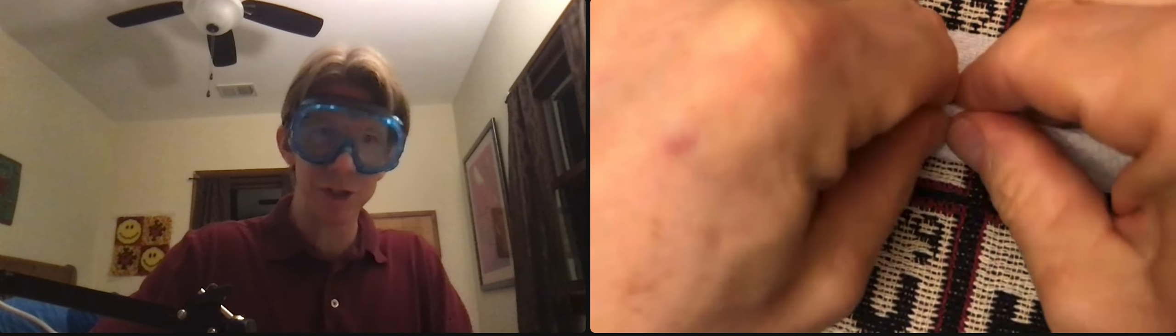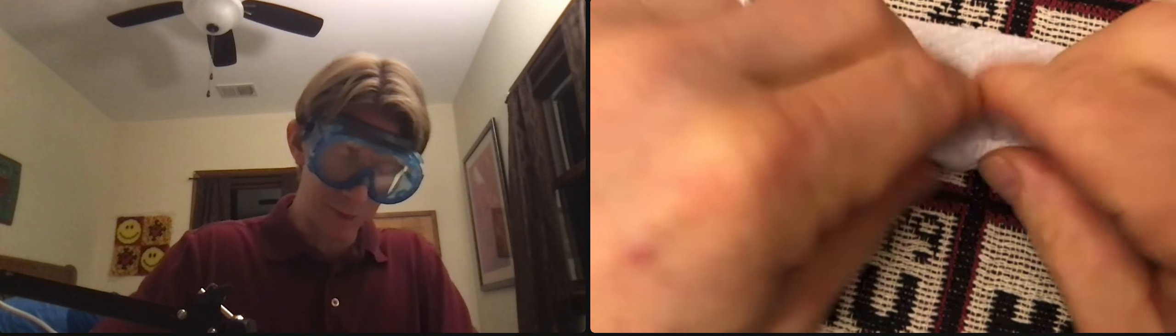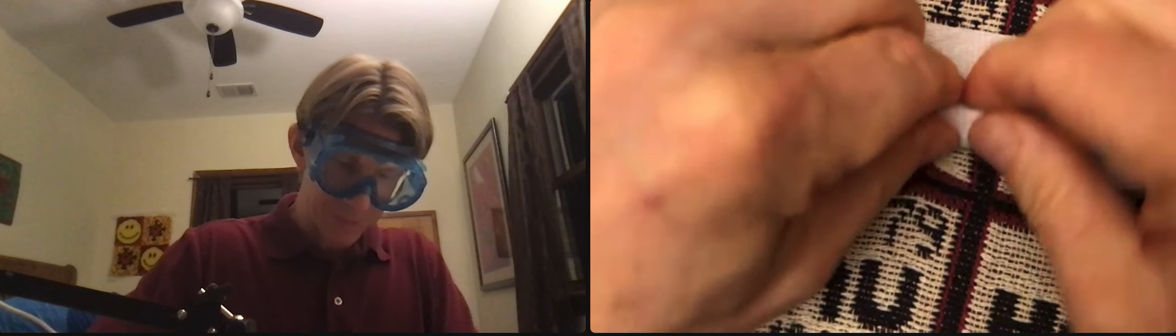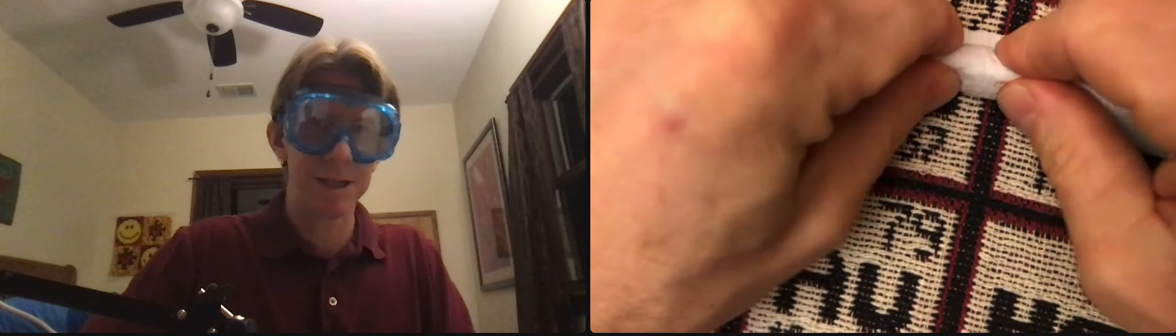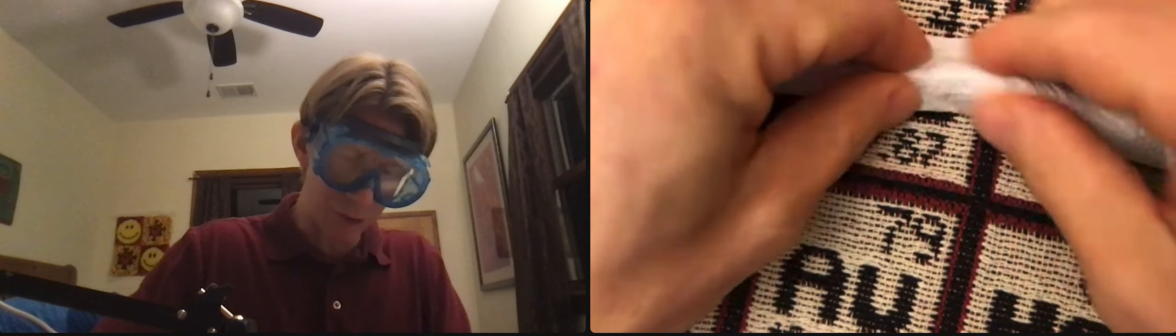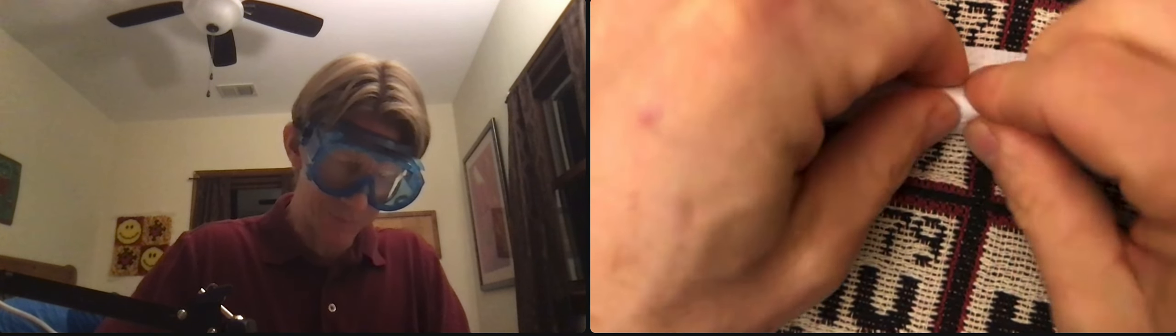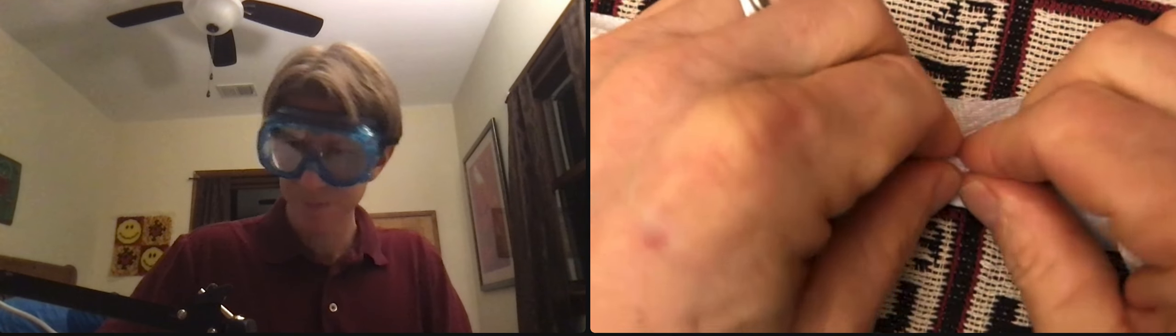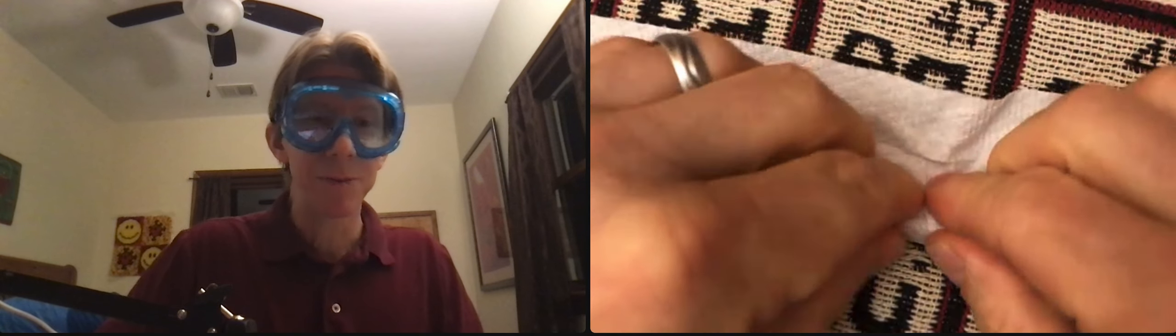I'll squish it, smush it, whatever term you want to use. Be careful because the paper towel can get holes in it. An earlier rendition of this did get holes in it, and I still managed to keep almost all of it.